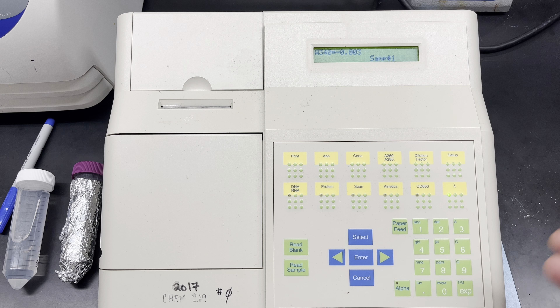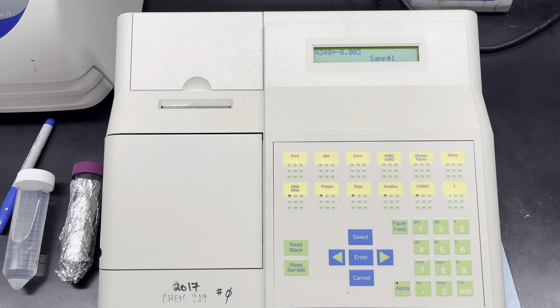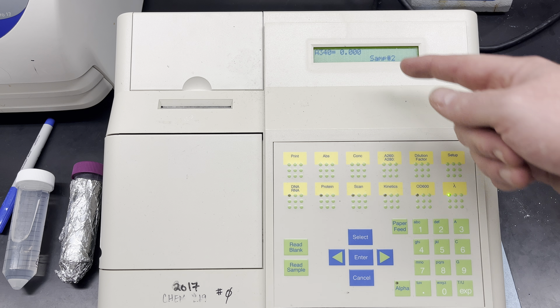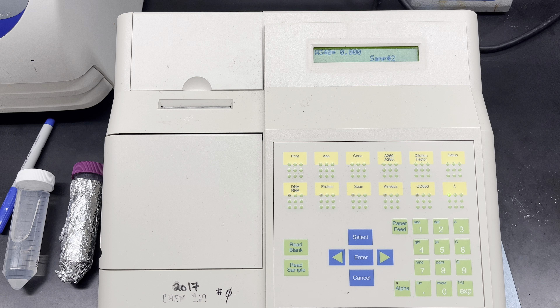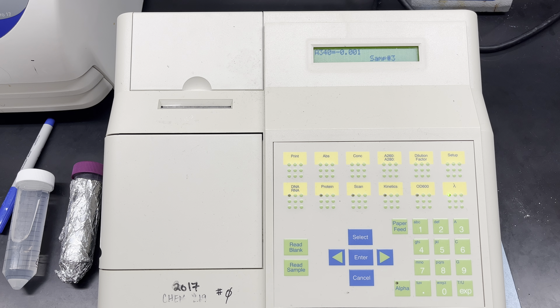This is going to give me a number and I'm going to count off 15 seconds. After 15 seconds have expired, I'll press 'read sample' again to get another number. I'll count off another 15 seconds and read the sample again — giving me a 15-second time point and a 30-second time point. Those two time points are what I'll put into my data set to determine whether NADH was being generated.